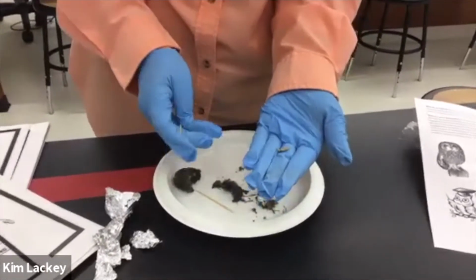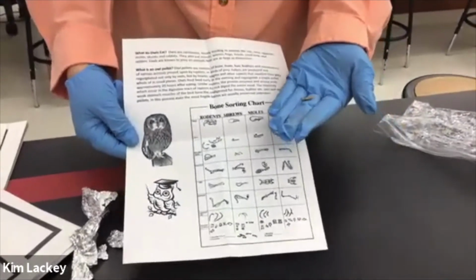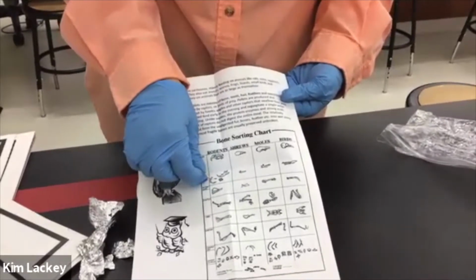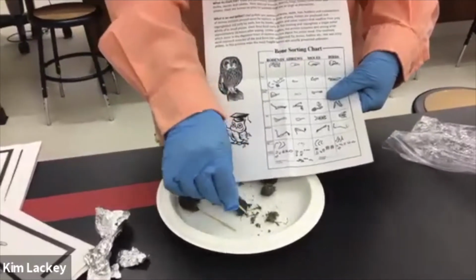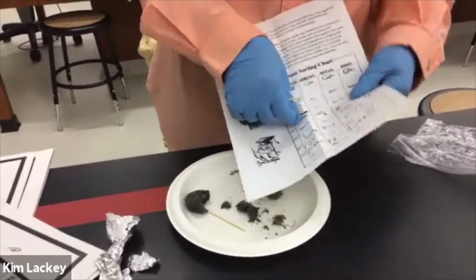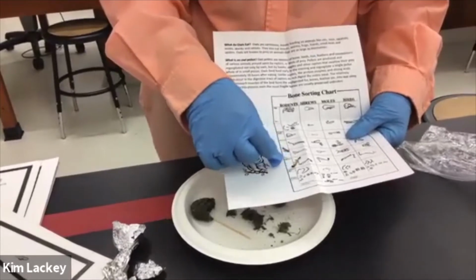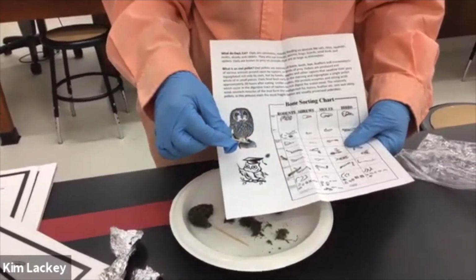And so then taking something like this, we could go over here and look at our bone chart and ask, it probably looks more like this rodent, and we saw here's our rib bone. And then we can come back over here and revisit, oh, what did this bone look like? Where did it line up? So we see if we can match up its shape and its form and its function. So it's probably more of a hind leg type of bone in there.